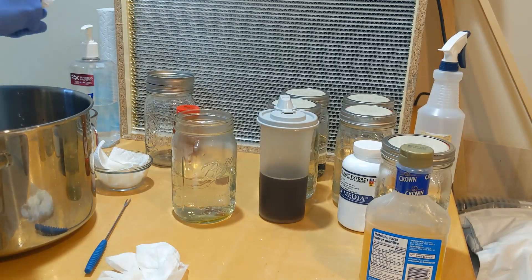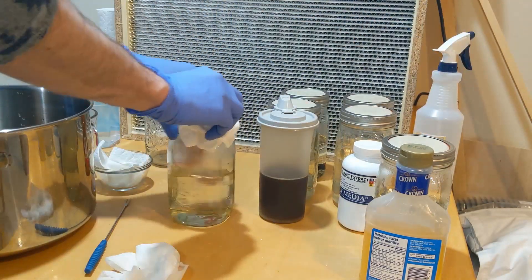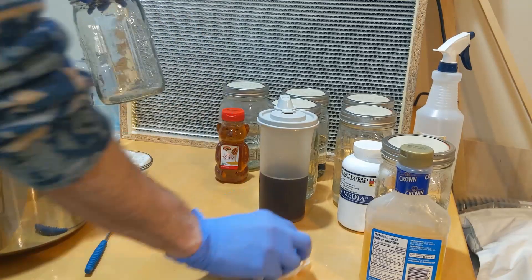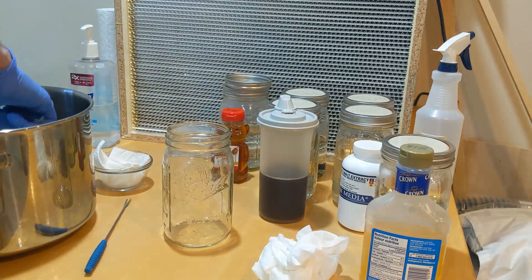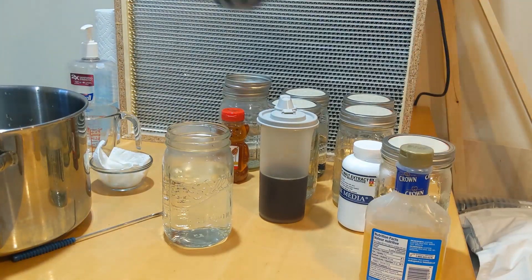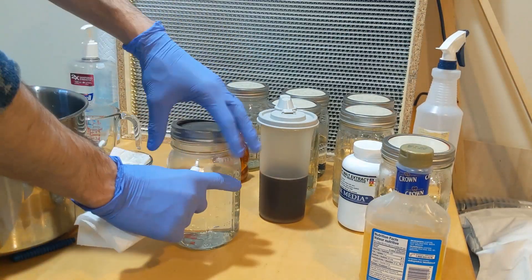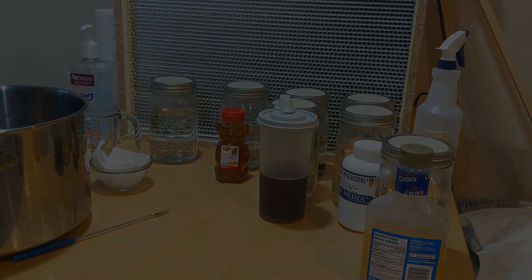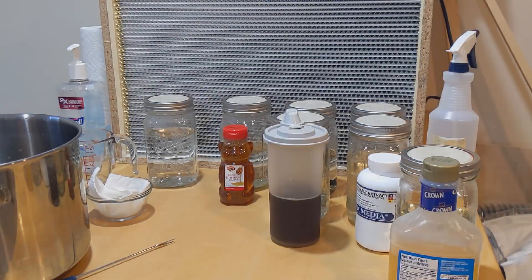And the last one is just going to be water. Like I said, I want to make a stock solution for spores. So we're just going to get water. And same protocol with the lid. We're still going to wipe it down upside down. And there you go.